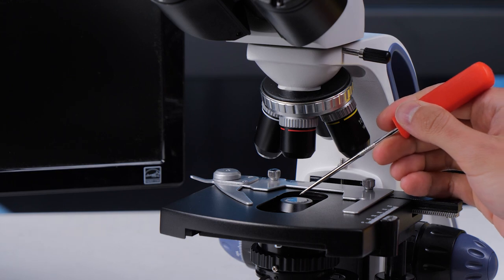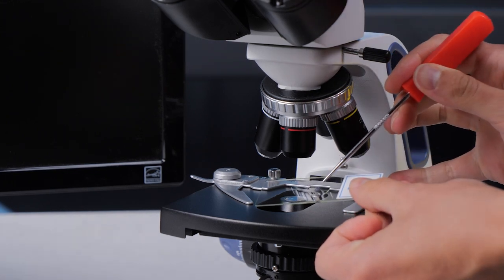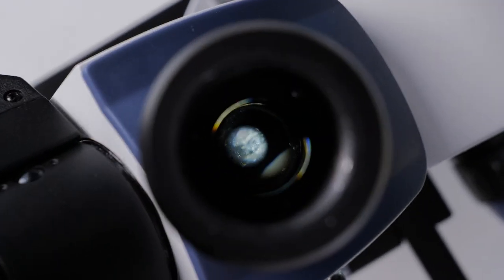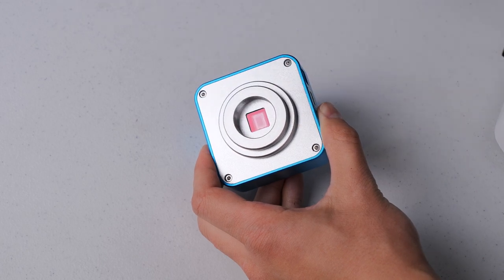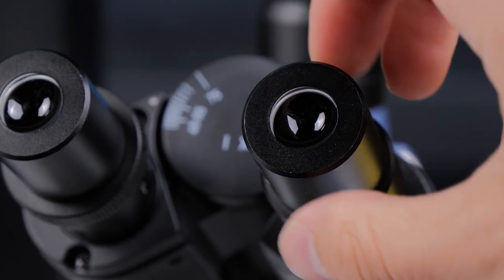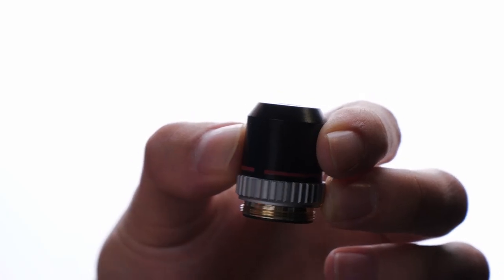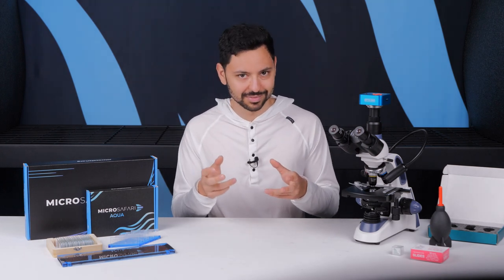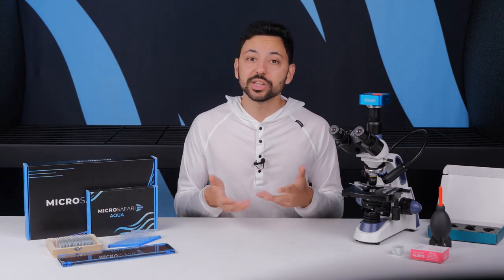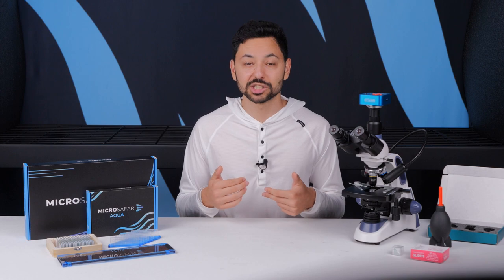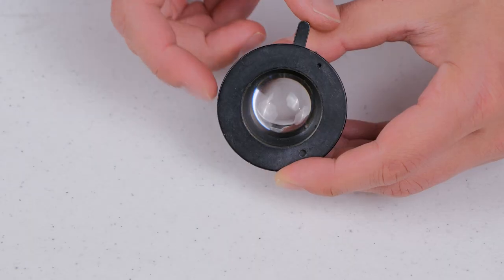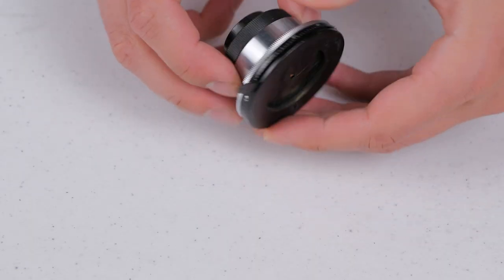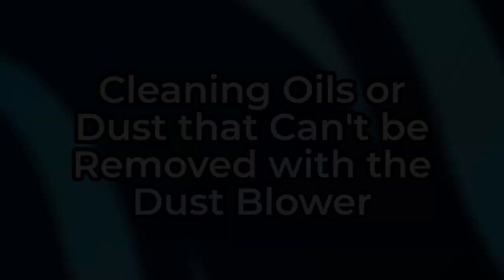Check on top of the condenser lens, on top of your microscope slide, inside the trinocular port or on the protective glass of the camera, on the eyepieces themselves, and inside the objective itself. This one's pretty rare, there usually isn't any dust that gets inside of the objective unless you're removing the objective and leaving it out. Note that dust will show up significantly worse if you're using the condenser with the iris closed down to a small aperture or using dark field illumination mode.